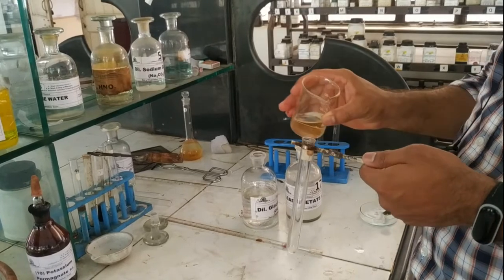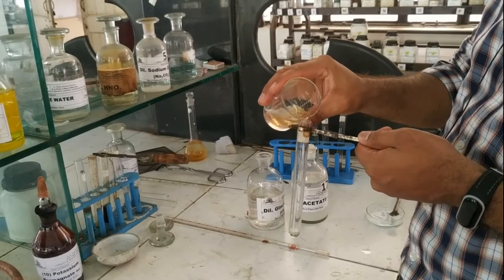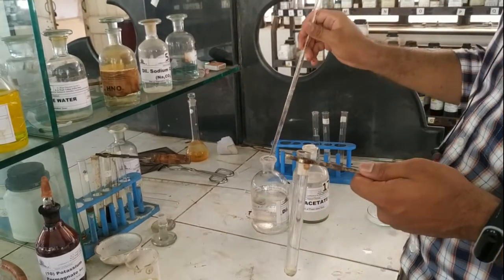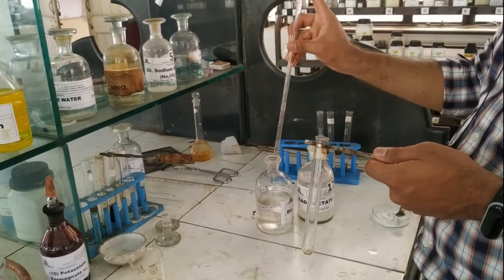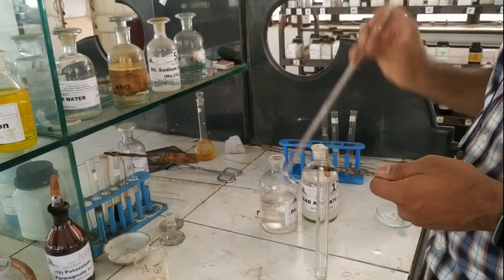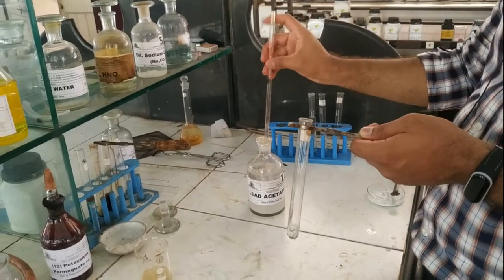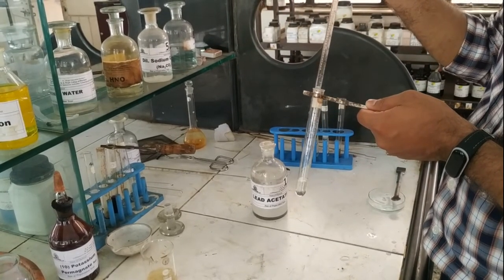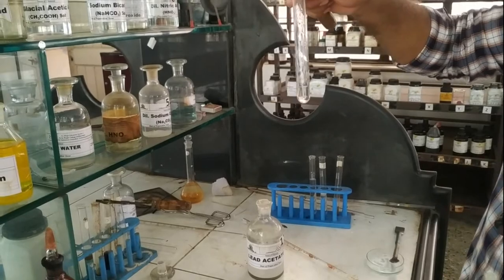Another test is the test for sulphur. Add 1 ml of extract, acetic acid, and 1 ml of lead acetate solution. No white or black precipitate is seen, so sulphur is absent in the compound.